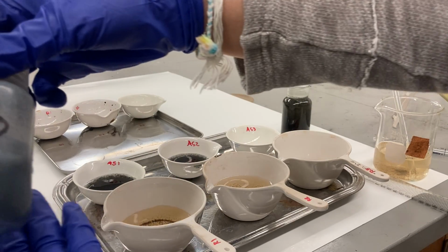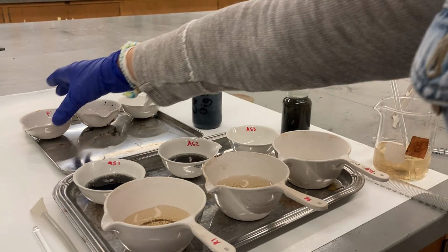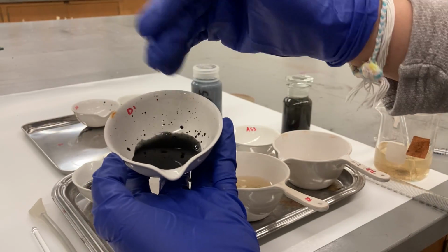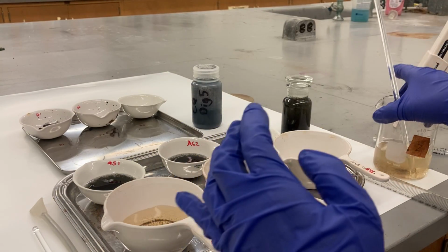And the digester, we're gonna use only 5. We're gonna use only 5 because it's so thick. You see, when I try to pipette it down, it spreads everywhere, on the paper too, because it is thick. Okay, let's start with the runoff sample.